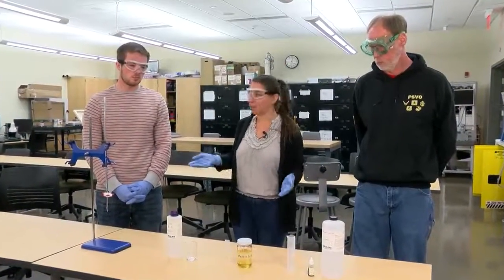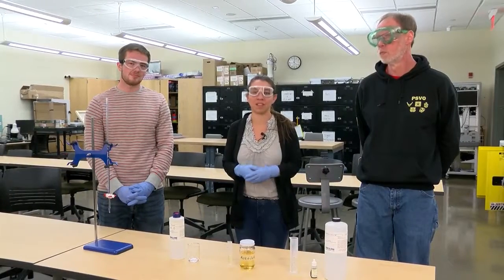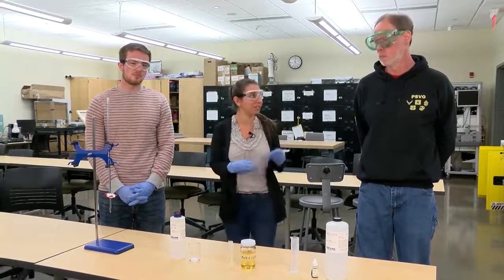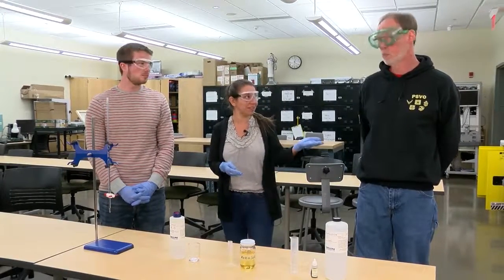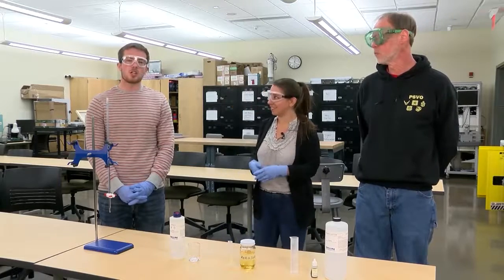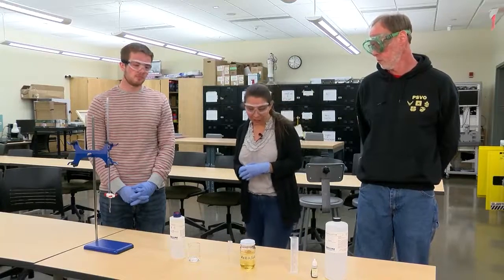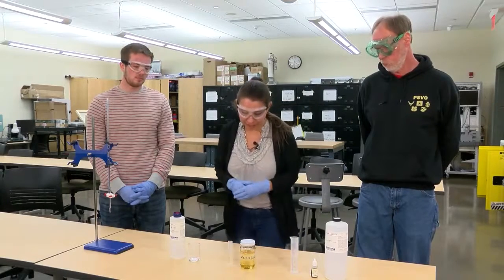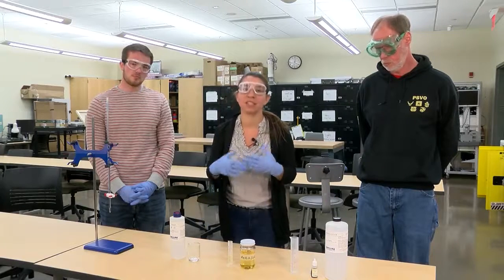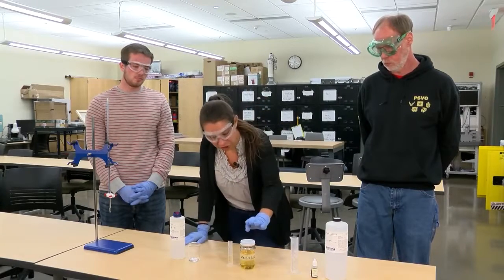Here in phase three I have two more students joining me from our sustainability and renewable energy systems major: Mark Lieb and Jacob Kaler. Here we're going to demonstrate some of the processing and testing that has to be done.